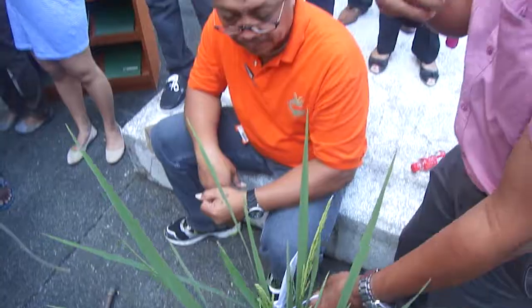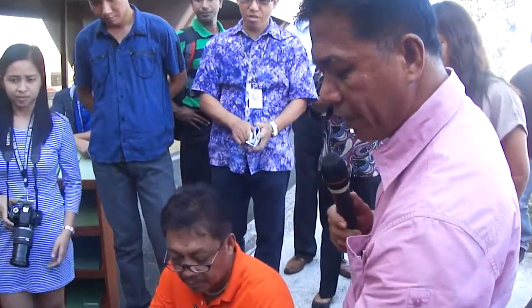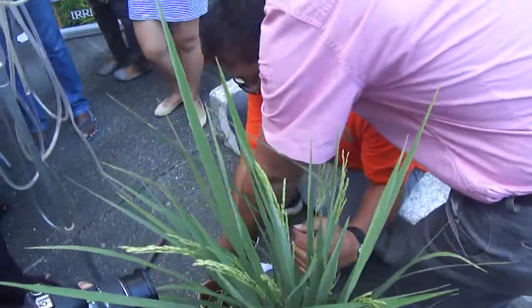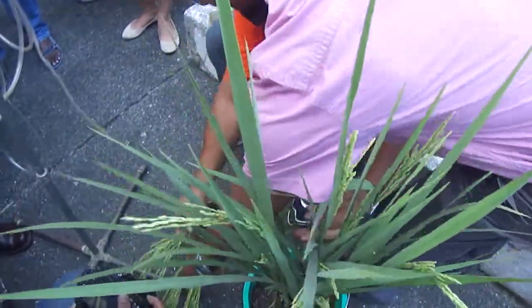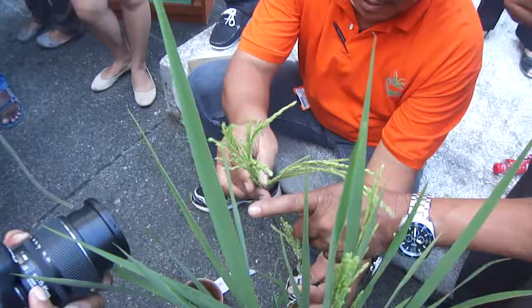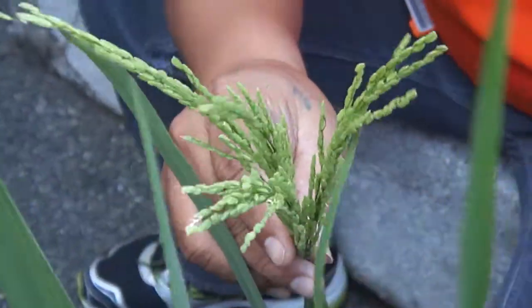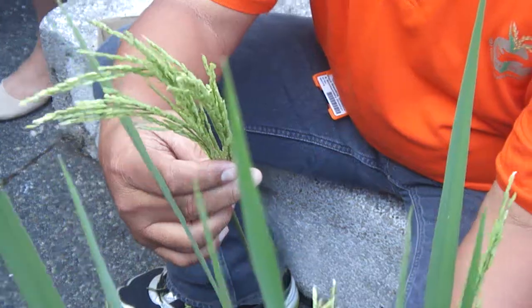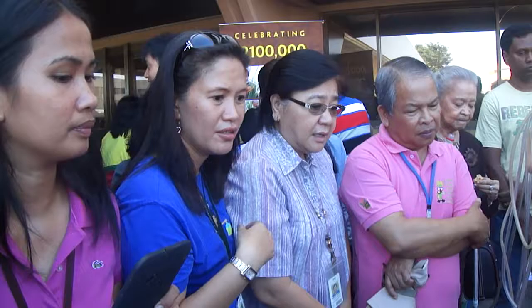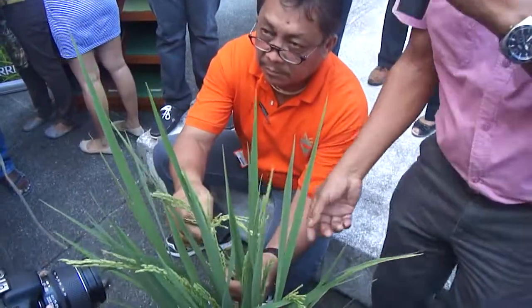The following day, you will remove the bag and put the pollen. You'll notice that at 9:30 there are no anthers yet, but usually around 11 o'clock the yellow ones will come out, and then you will put the anthers inside the floret. You will see a lot of pollen going down inside the floret.